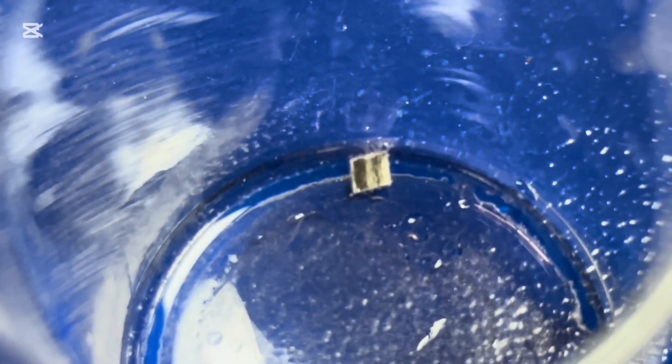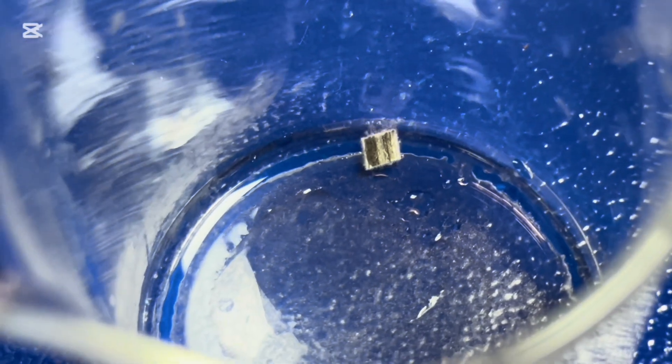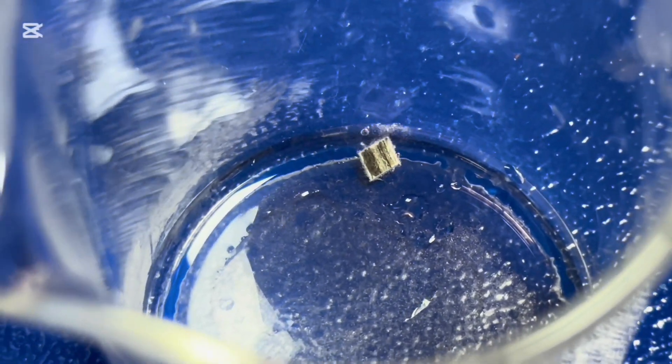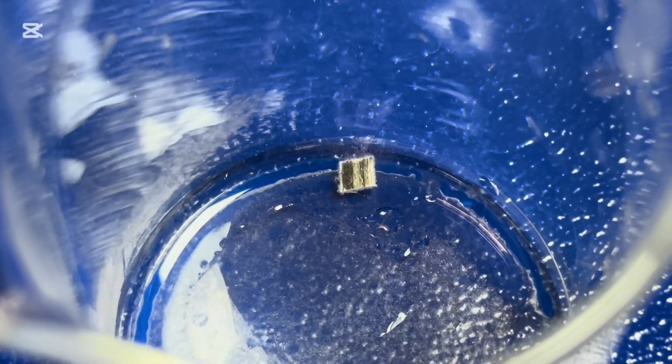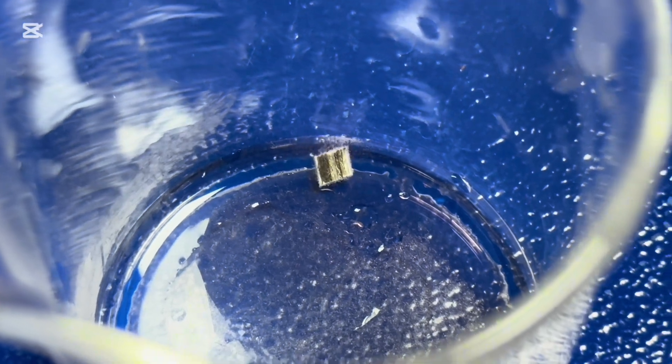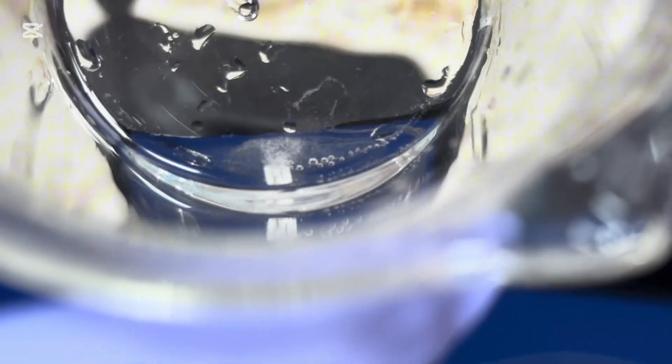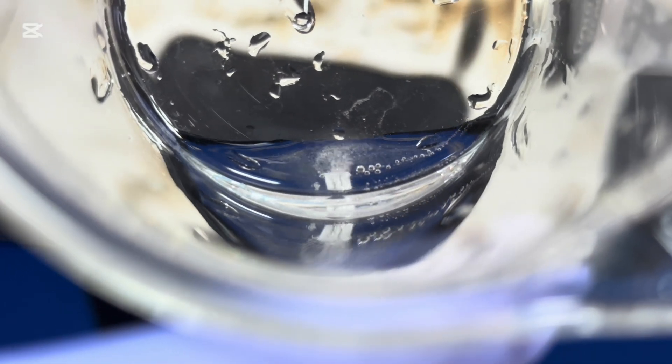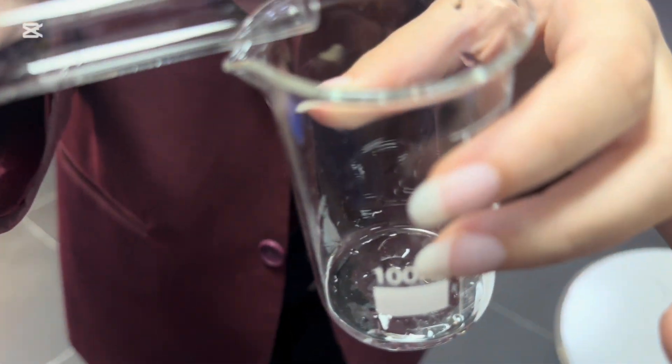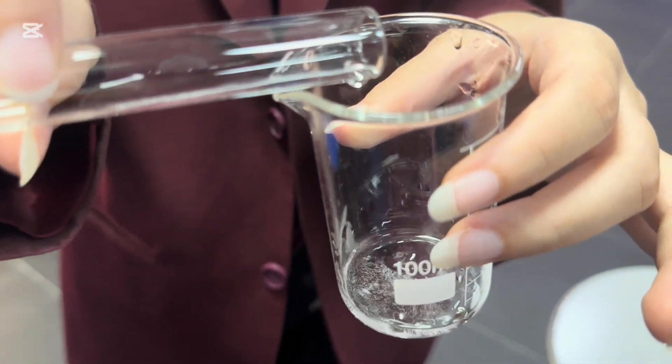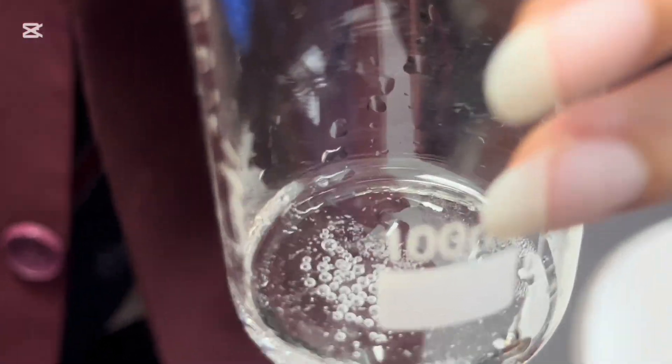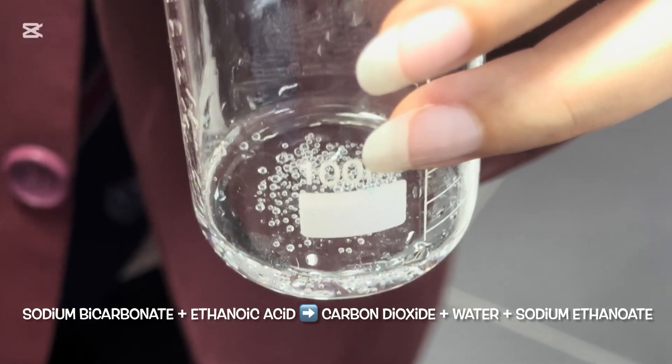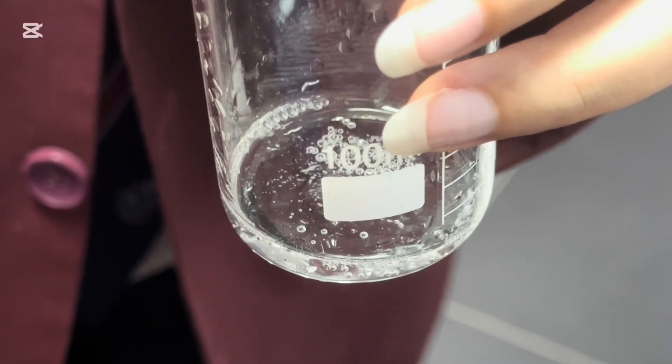And my assistant here, Latifa, who is going to add the sodium bicarbonate and we've got fizzing. There it is.